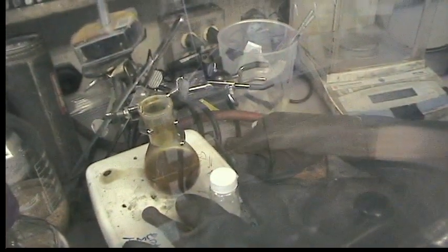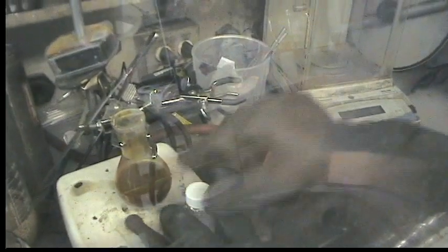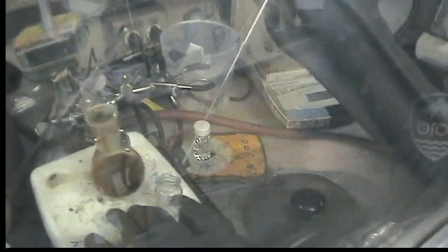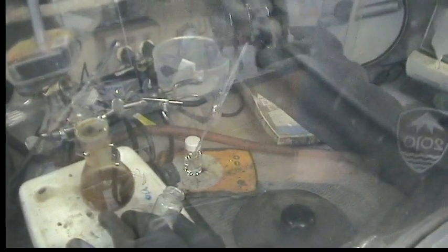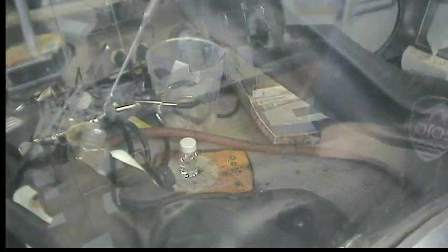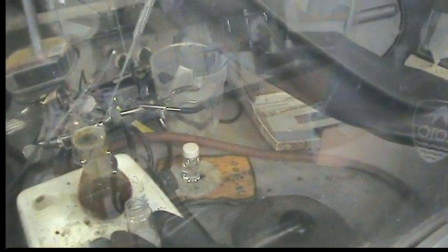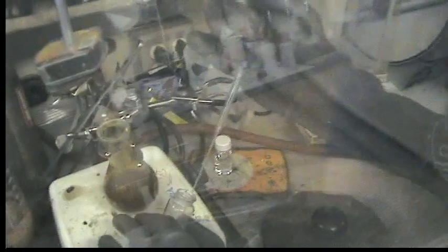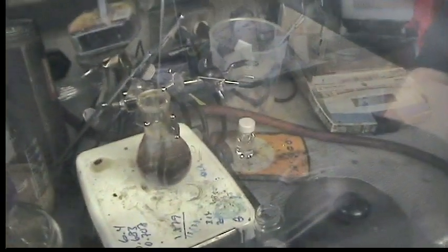We're going to try to get this stirring, and then we're going to slowly add our thawing solution of arsenic trichloride in THF. How long did you let the two reagents cool down? They cooled down for about 10 minutes until they just started to freeze. You'll start to see pretty soon that this is going to change appearance and become sort of dark red-black — it goes from that kind of yellow-orange color of the P3 anion and darkens.